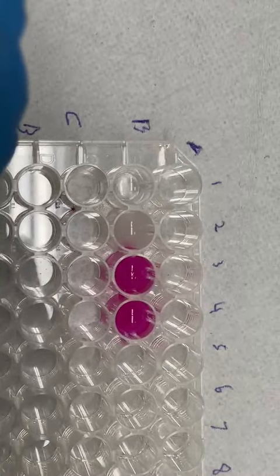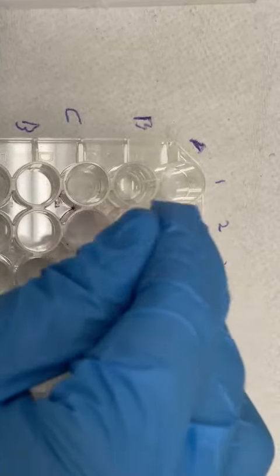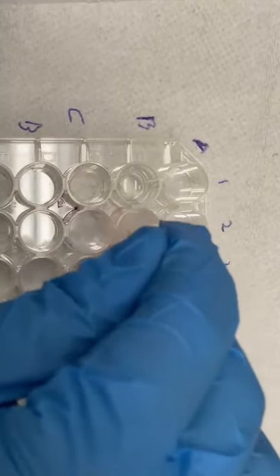Oh, it's hot. It's hot. They all turn around like idiots. I think it's not right. Let's do more.